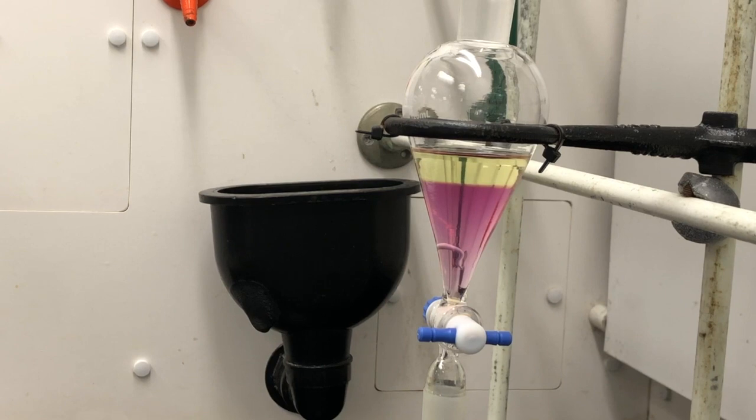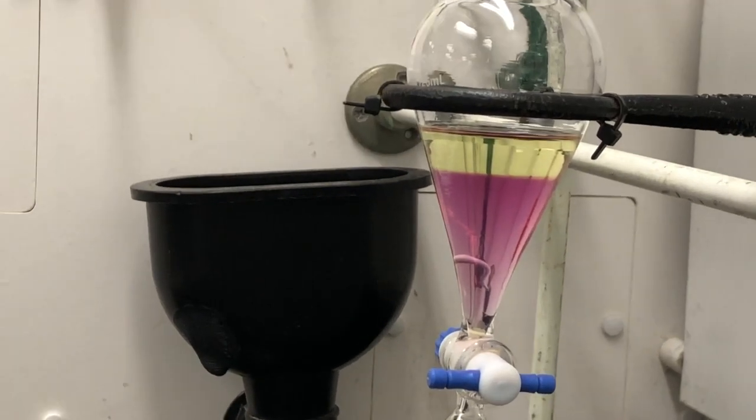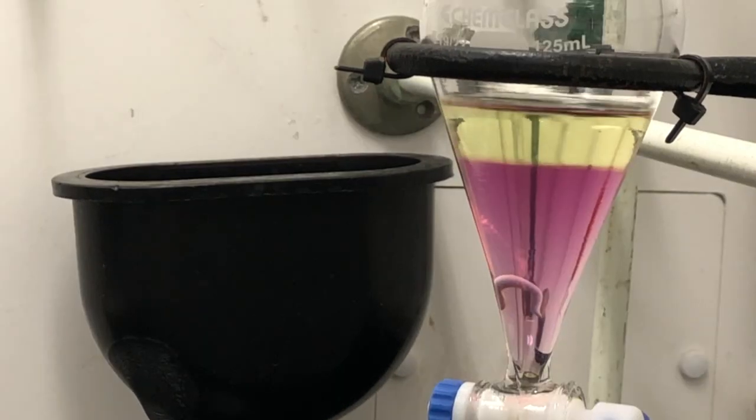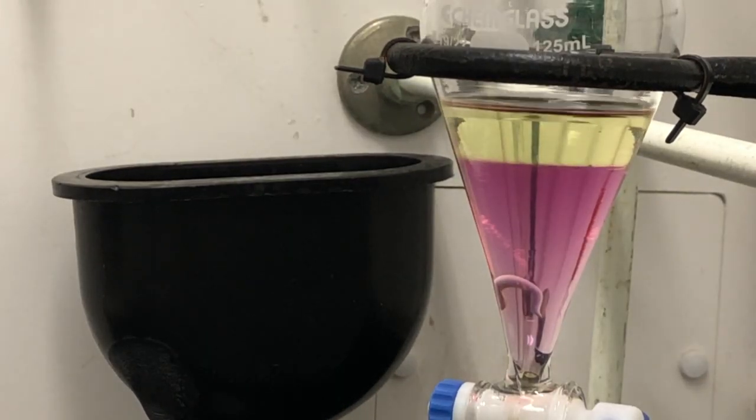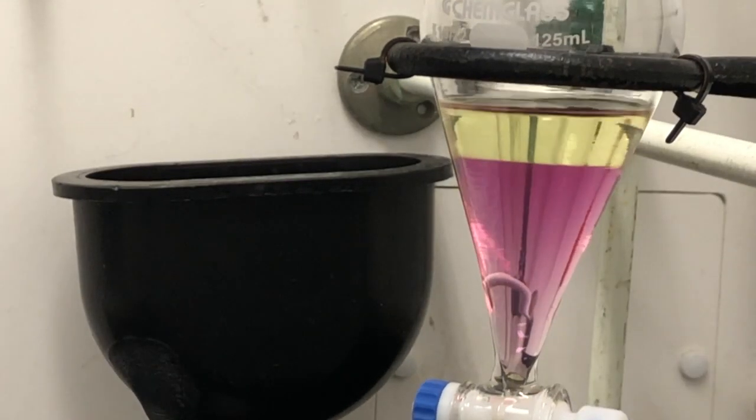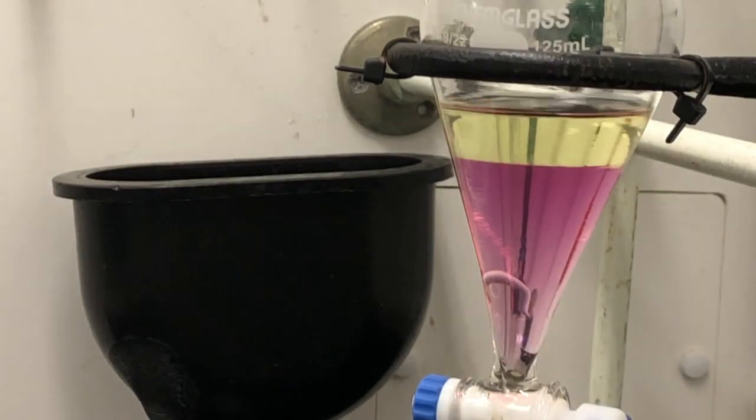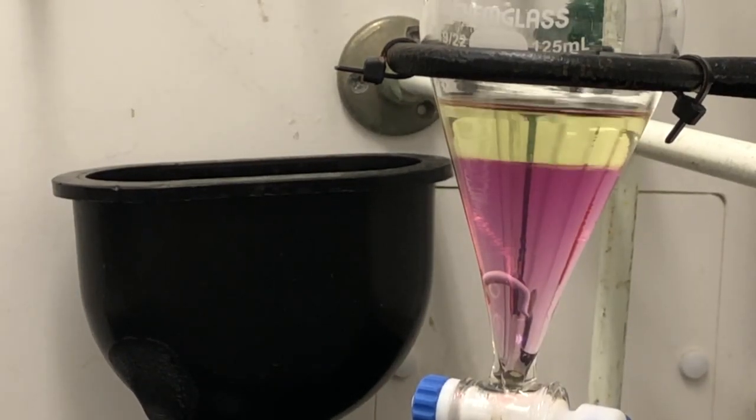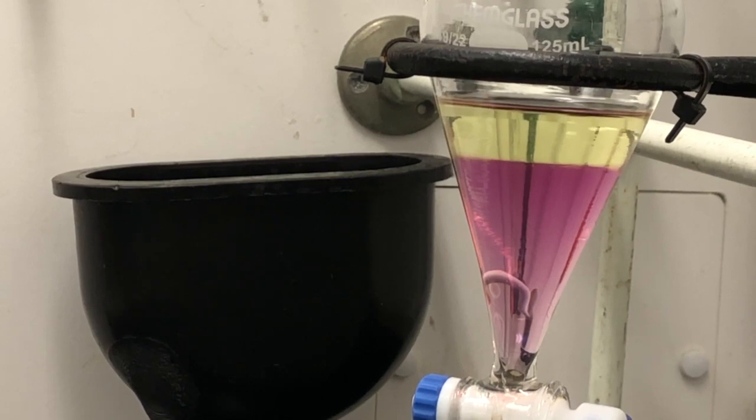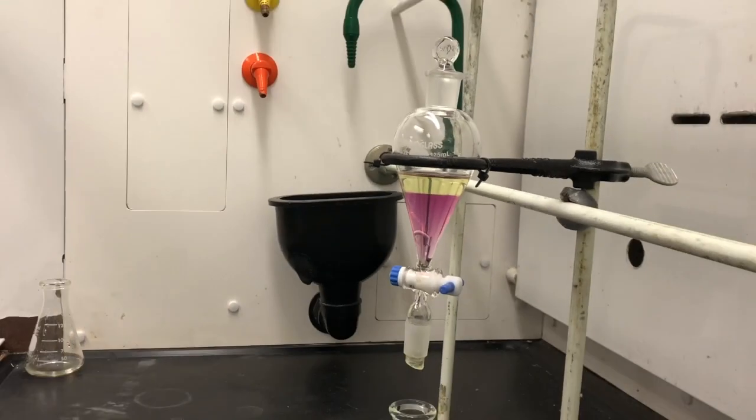Another option is to add a drop of water and notice where that drop of water goes in. You may notice that it went right into the second layer. All right, so now we're going to go ahead and dispense it into our flask.